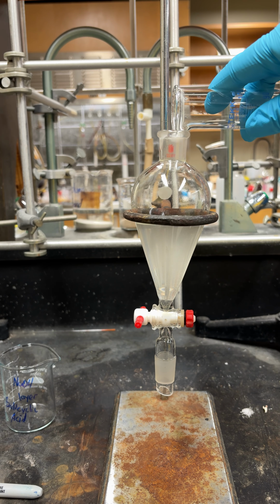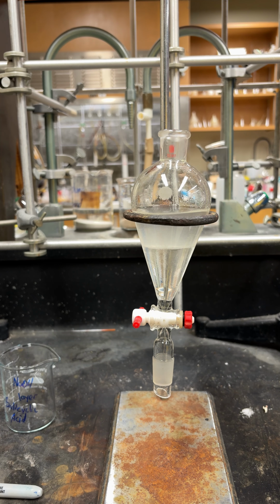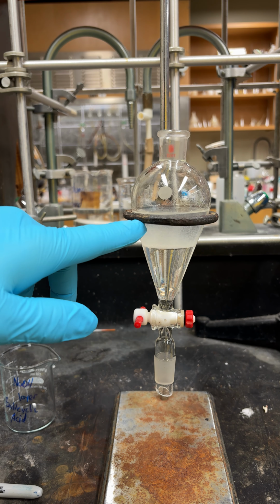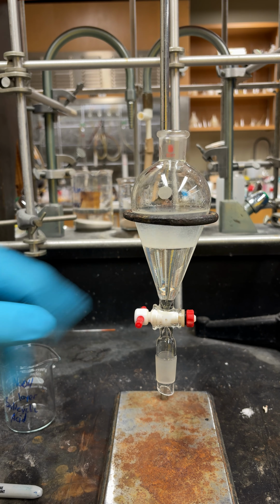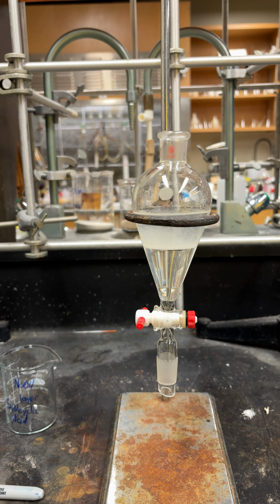So if you remember, like dissolves like, in this case, ether isn't soluble with water or aqueous HCl solution. So as you can see, you have a nice bilayer that's formed. The top layer is your ether layer, the bottom is your aqueous layer, which is the HCl. It is more dense, so it's on the bottom in this scenario.